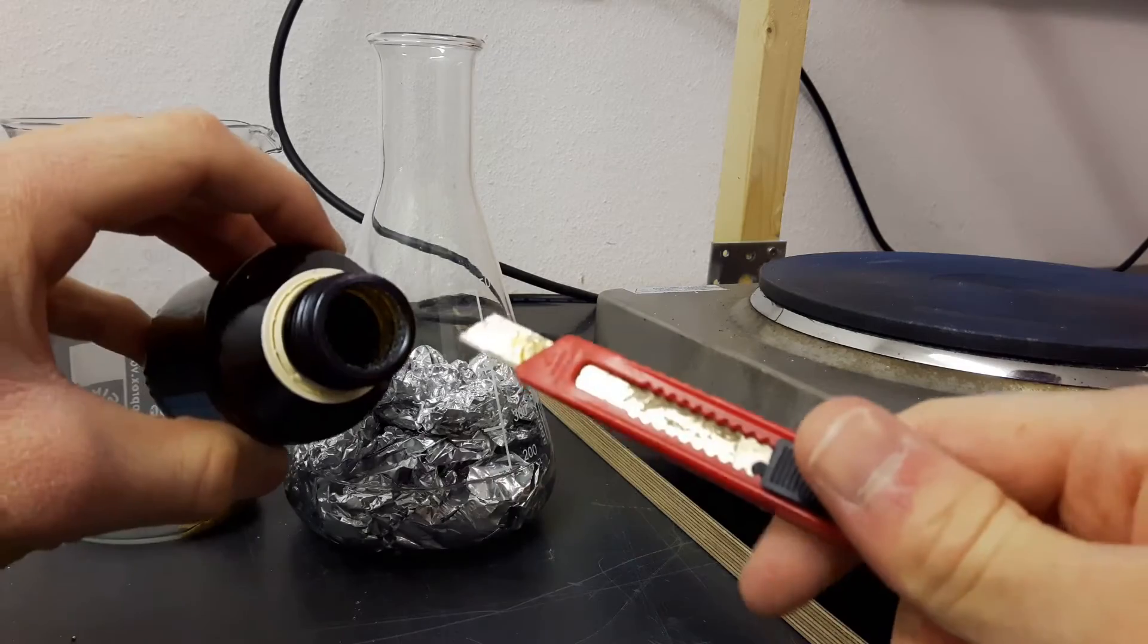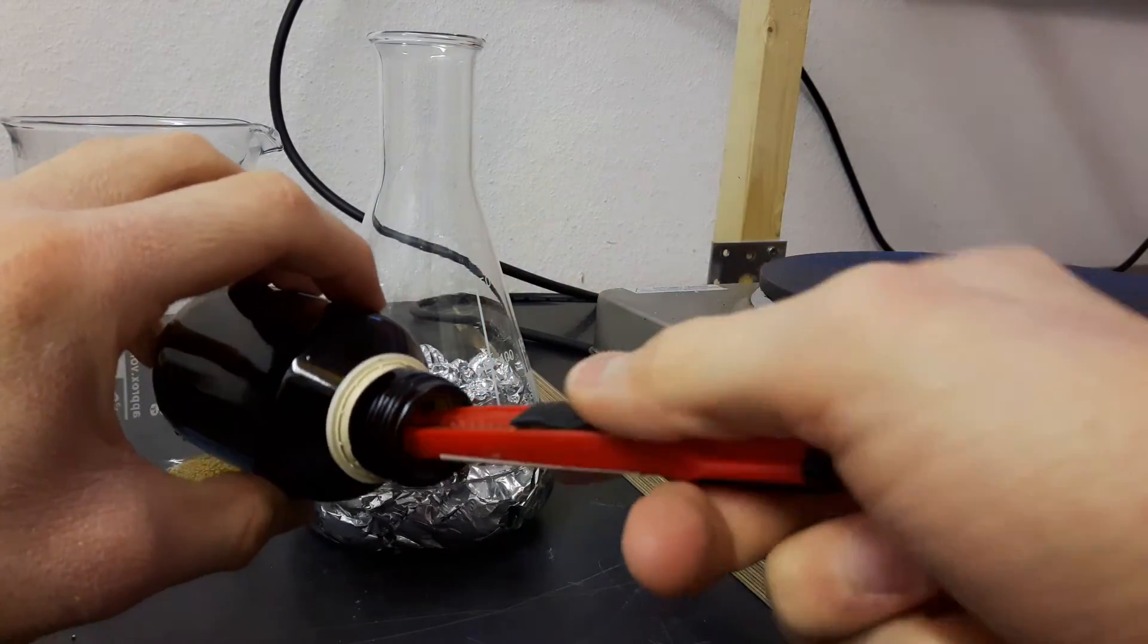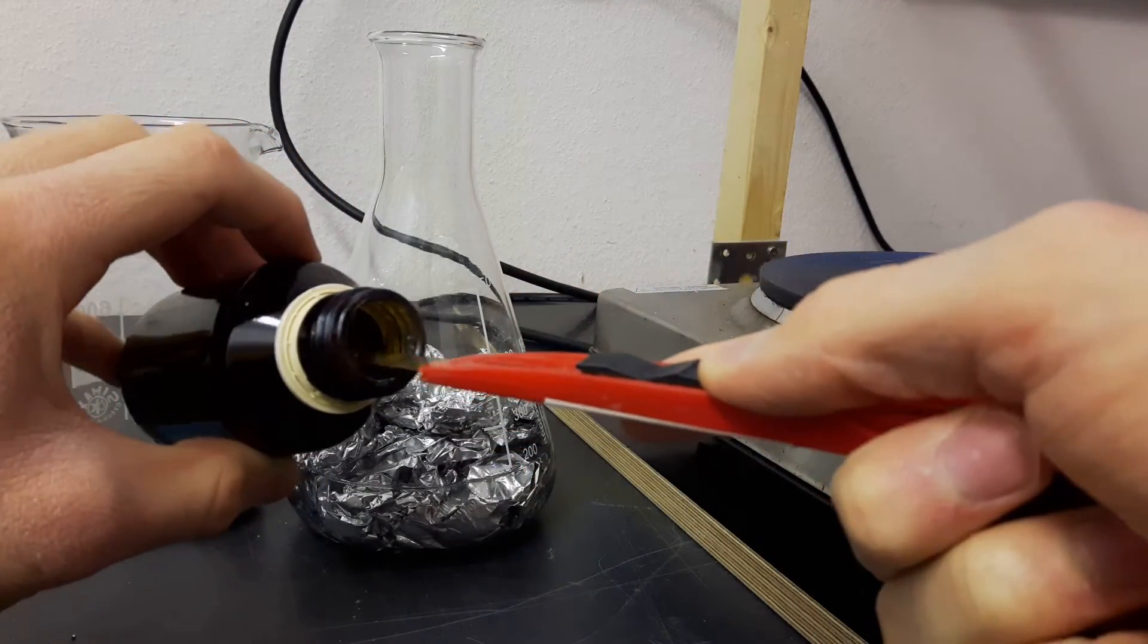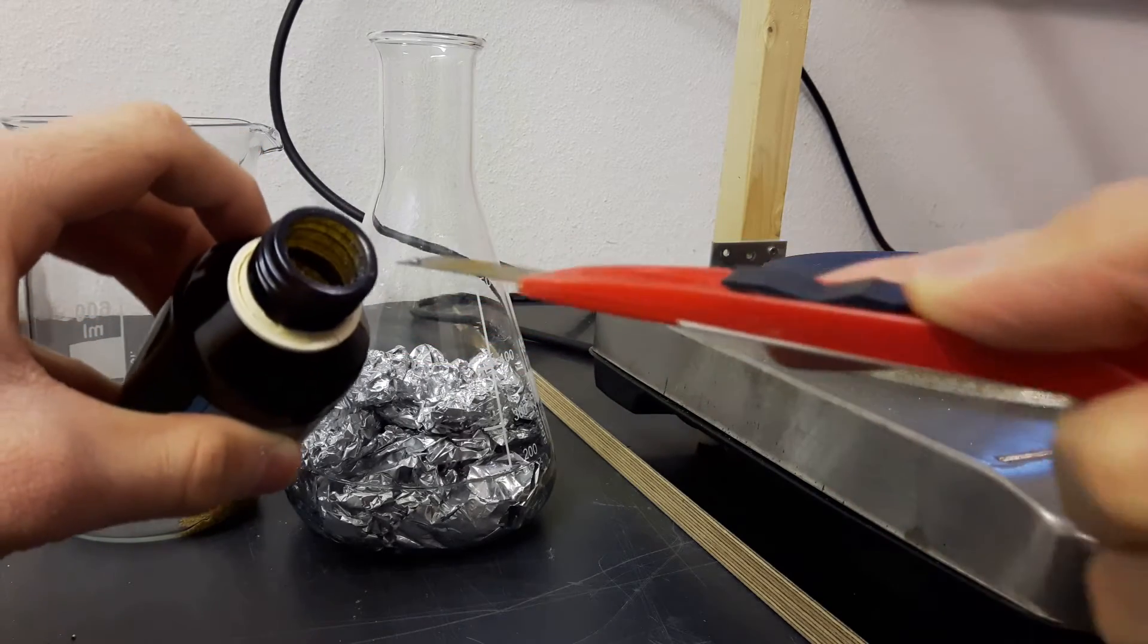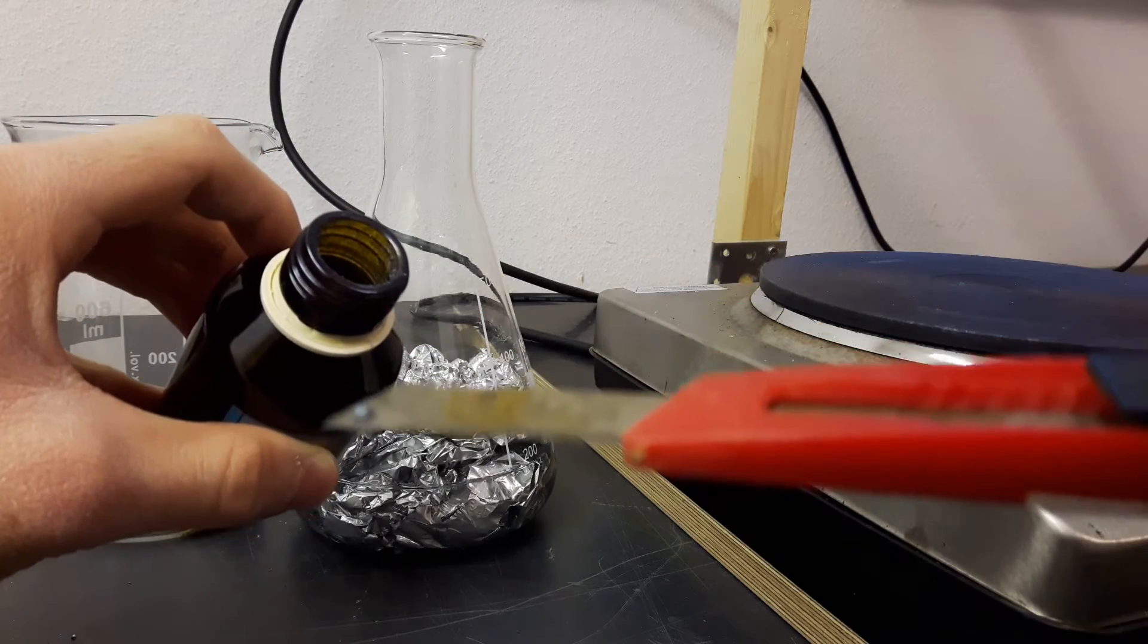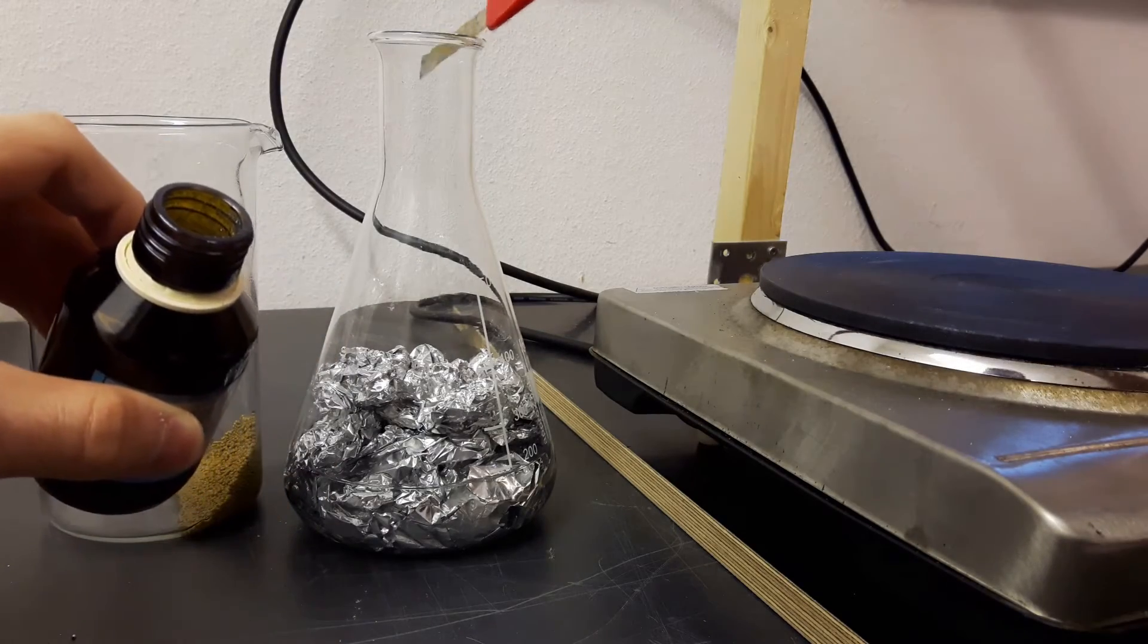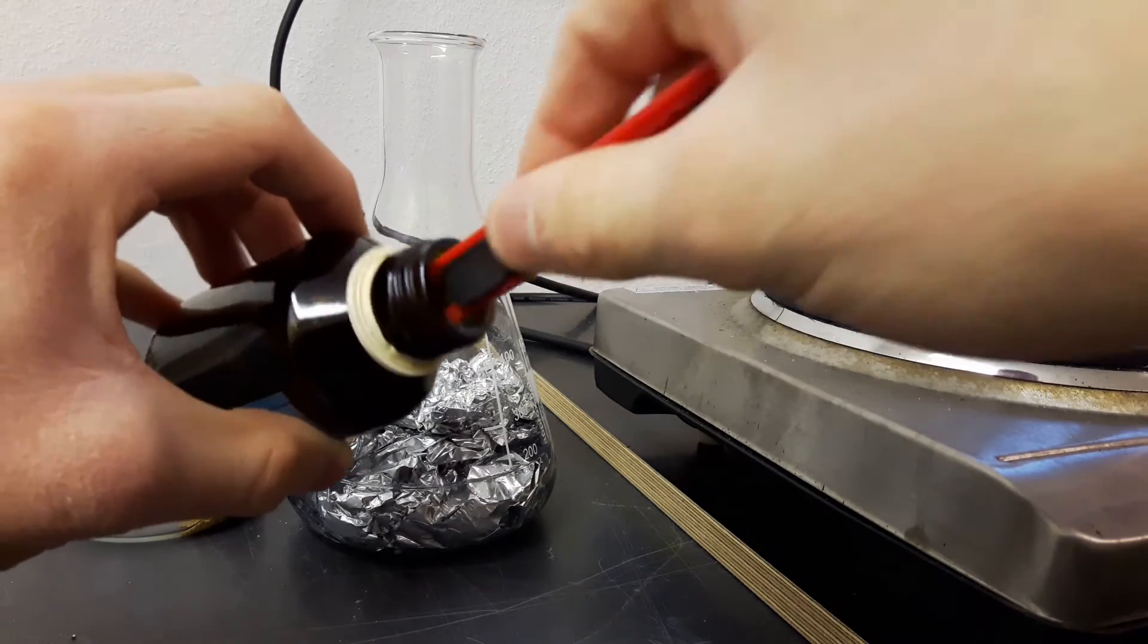So I want to say while I'm starting here that this took really really long. So it needed 3 days to entirely react with most of the aluminum. And it was really a huge pain to do all this work.